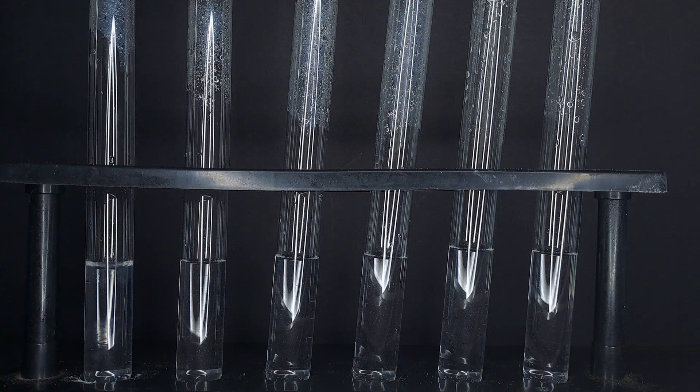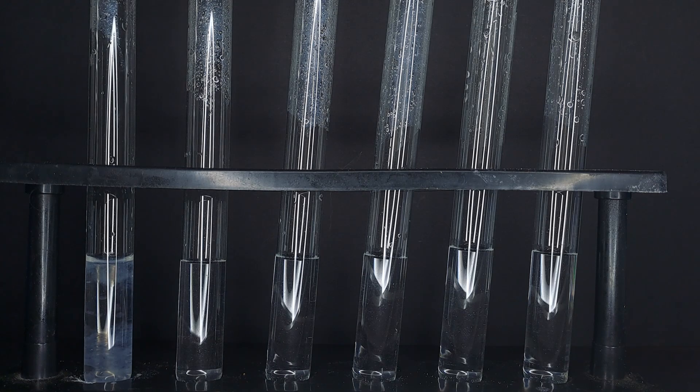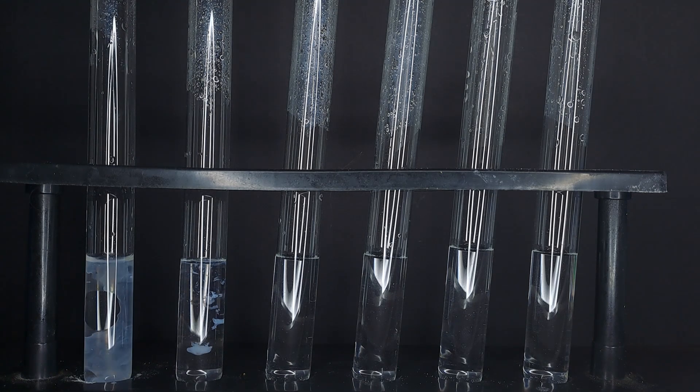When we add sodium hydroxide to the first solution we immediately see a gelatinous white precipitate. The sodium hydroxide solution used is at most one molar.